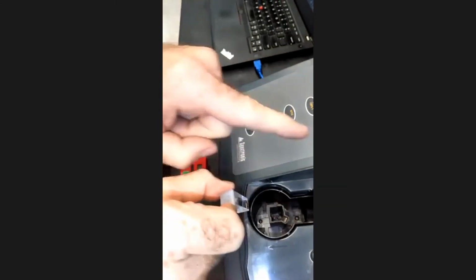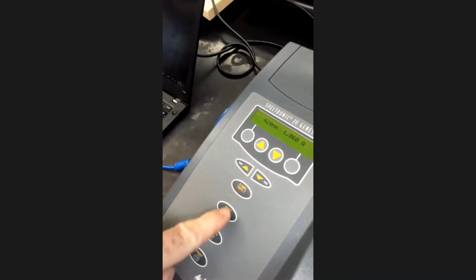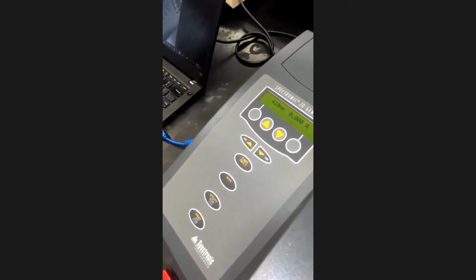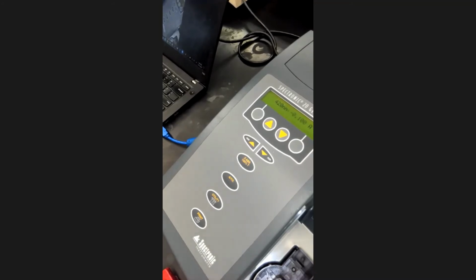So I need to make sure that my ridge sides are oriented sideways, my clear sides are oriented front to back. I slide my cuvette in, I close the lid, and for this first one, I'm going to hit 0 absorbance / 100% transmission. This is essentially my tare button to say however much absorbance you saw in this sample, count that as 0 absorbance, because this was the one in which I know that no reaction took place. Okay, now I'm going to take that sample out, set it aside, and move on to my next sample.